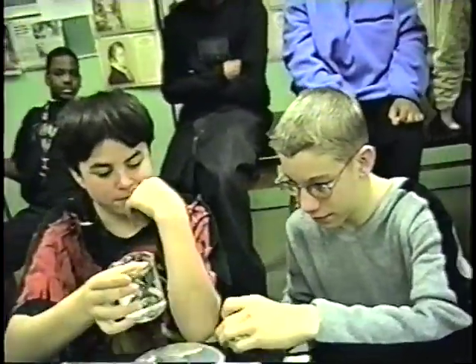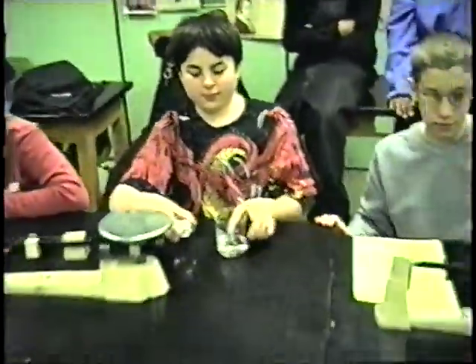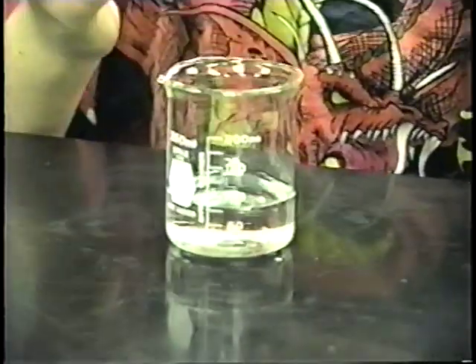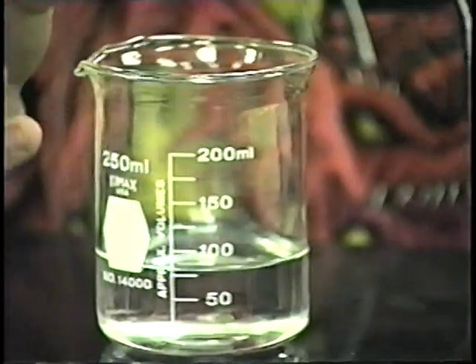Okay, now, let's see. Joe, I want you to pass this over to Matt, and Matt, very carefully, we want you to place it so we can see what's going to happen when you do this. We want you, when I tell you, because there's a reaction that's going to take place, and hopefully we'll be able to see it, we want you to drop the rocks into the liquid when I tell you, not yet. Okay, drop it in.